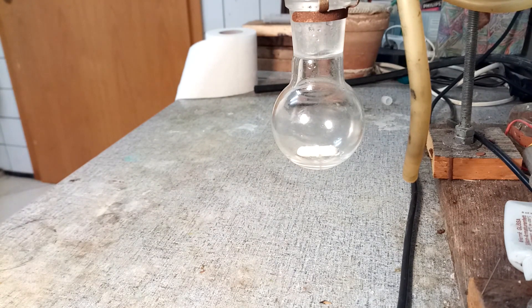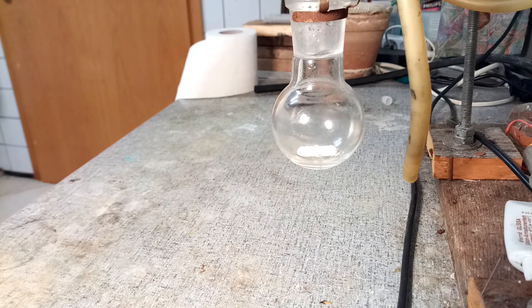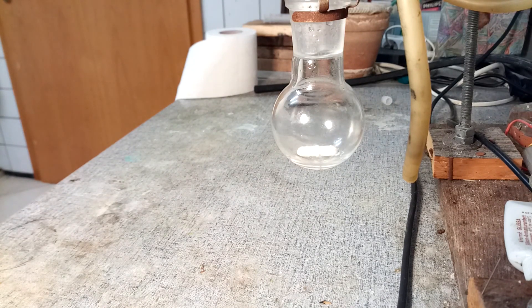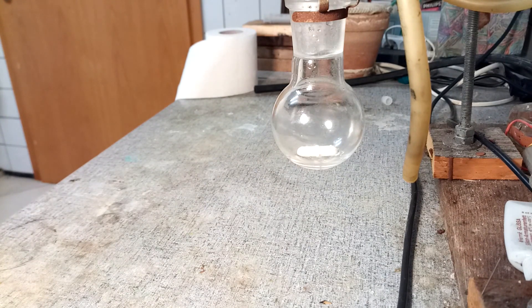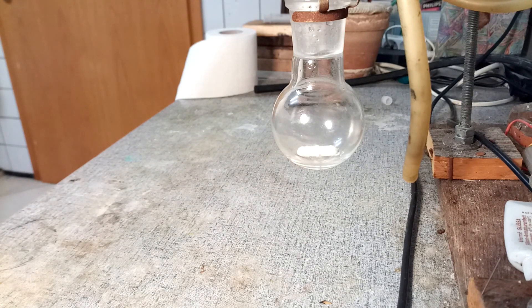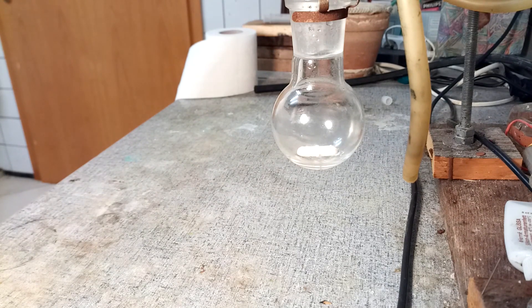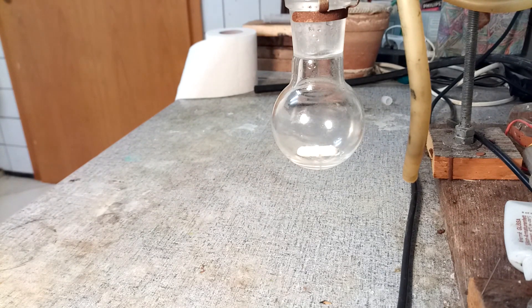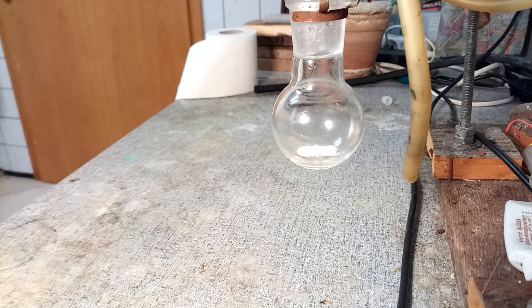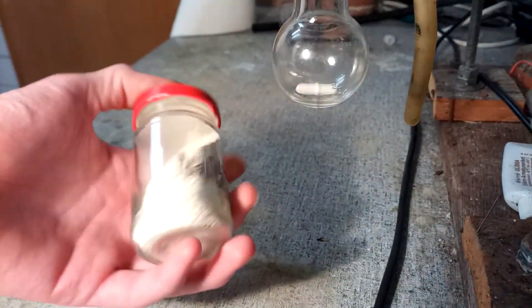With 25 grams, the reaction is a bit more violent, but that doesn't really matter. The yield is about the same based on starting nitrate — not based on what nitrate was consumed, but based on starting nitrate — so really you get more product out of the same amount of starting material. The yield is actually slightly better and the product is more pure. The only problem could be scaling it up because that reaction was a bit more violent and it might not scale too well. Anyway, got a bit of nitrite now.